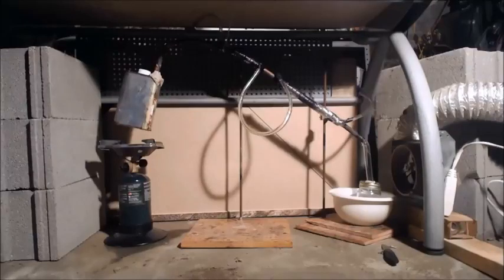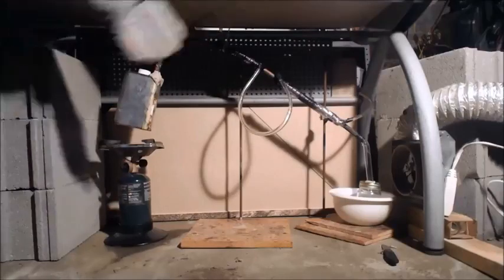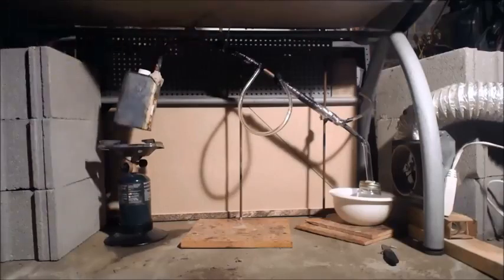I got a heavy, this board on top here, I swear to God, it weighs like 50 pounds, or at least 40. And so everything's pretty contained. I was going to put plexiglass in the front, but I'm just going to let it go because there's nothing really there except the camera.